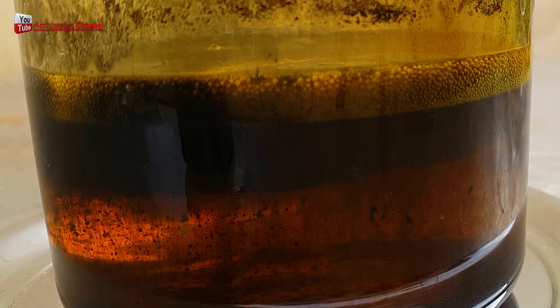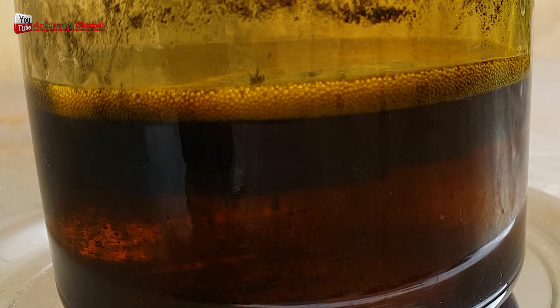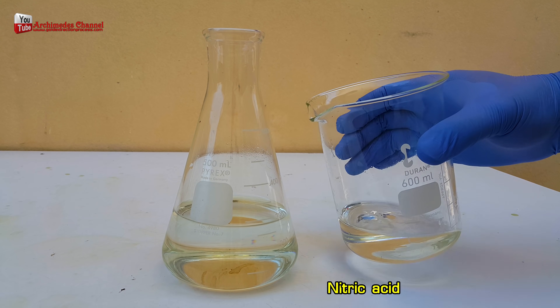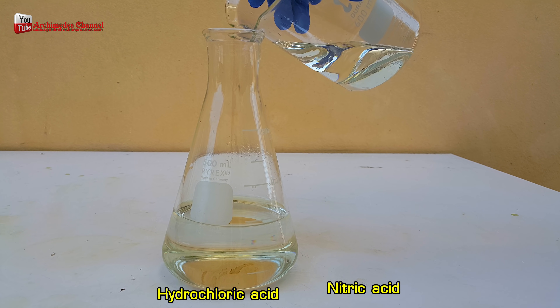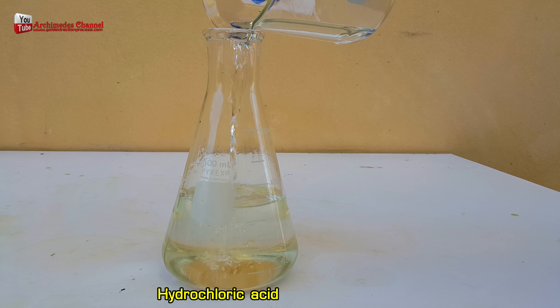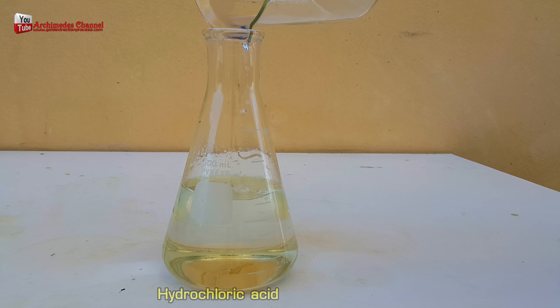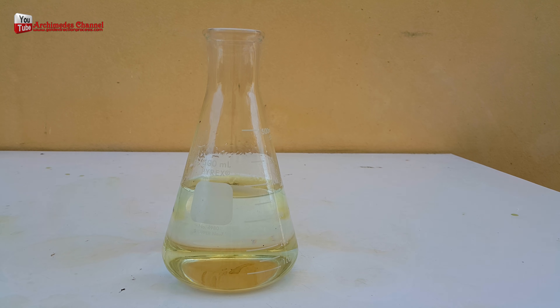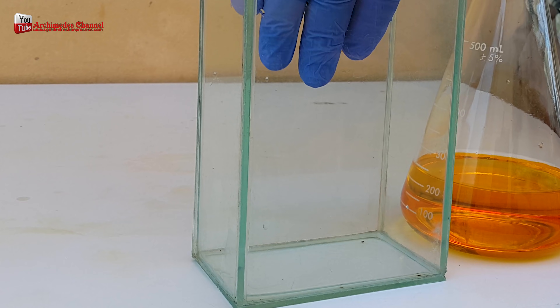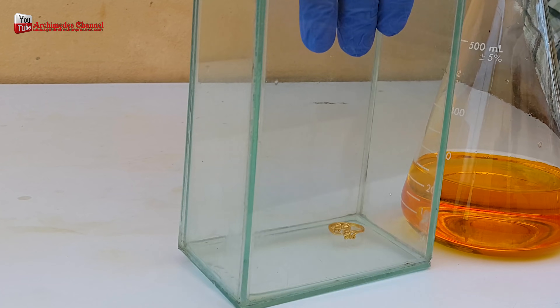Hello friends. Aqua regia is composed of two chemical substances with a ratio of 1 part nitric acid to 3 parts hydrochloric acid mixed together. The ratio between gold alloy and aqua regia acid is 50 grams of gold alloy to 200 millilitres of aqua regia. From my experiment, gold alloy was made into a solution at a temperature of 90 degrees Celsius to reach saturation point.